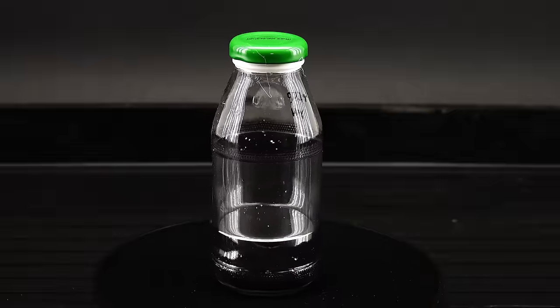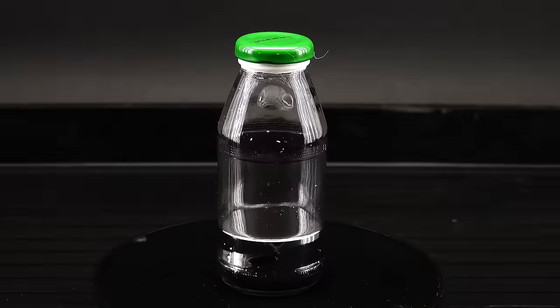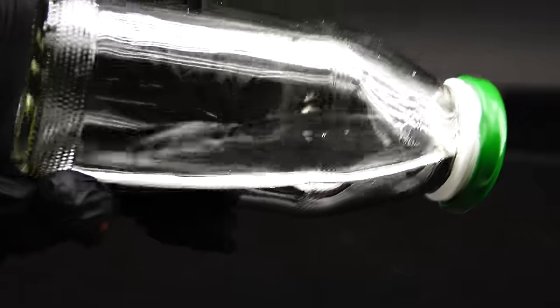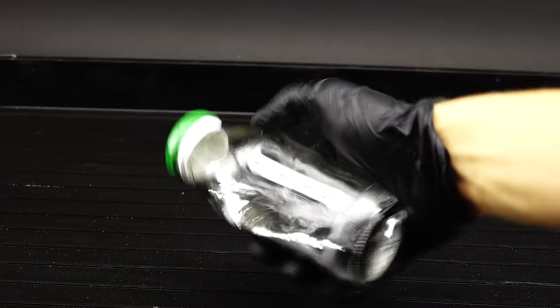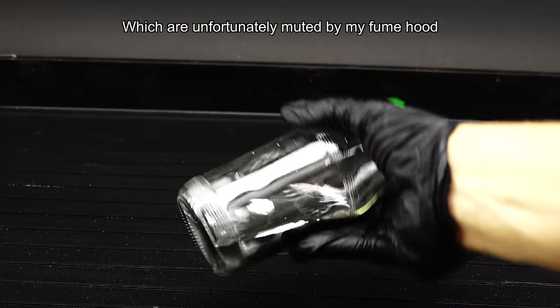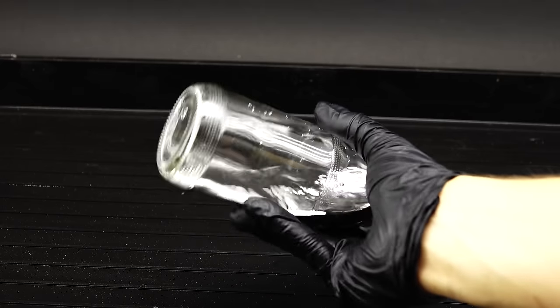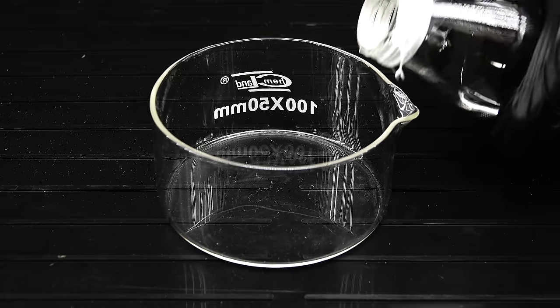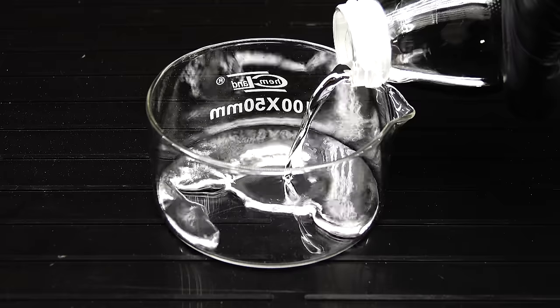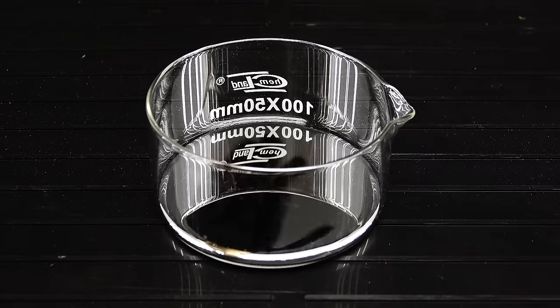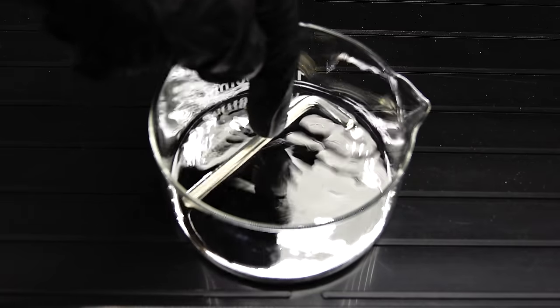Okay, now with all the safety gear in place, let's take a closer look at the mercury bottle. As you can see, this mercury is really clean and doesn't wet the glass at all. It also makes this weird and oddly satisfying sound when moved around, and still surprises me by how dense it is. What's also really interesting about mercury is that it pours completely unlike everything else, and how it forms a perfect mirror on its surface which can float almost anything.